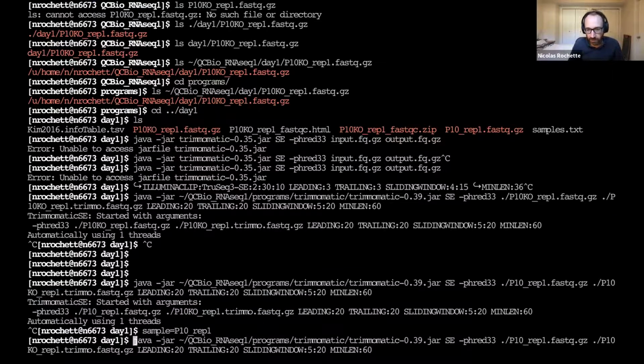And so I can take my command line like this, and in this case, this is a command line with the two different samples. But actually, the idea is that we just have this blank thing here, or these two places in the command line that should have the same value, right? And so this idea of shell variables, that's the tool that's going to let us change these two places at the same time, and then we don't have the risk of human error anymore.